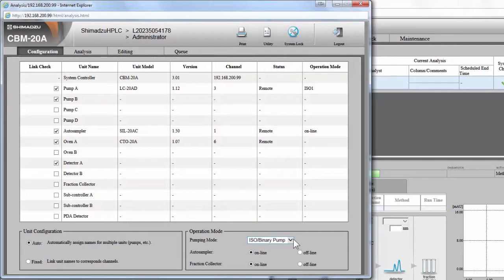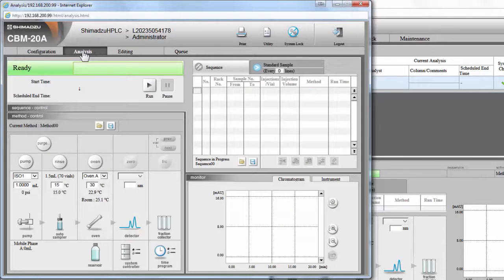In the Operation Mode box, you will see a drop-down menu that allows you to select the pumping mode for the HPLC system. Depending upon your hardware configuration, this can be set to isocratic, binary, or low-pressure gradient. In the Analysis tab, you start by seeing the actual button controls for your HPLC system. Here you can turn on or off each module, set flow rates, column temperature, and detector wavelength. Additionally, you can save and load previous method files you have used.